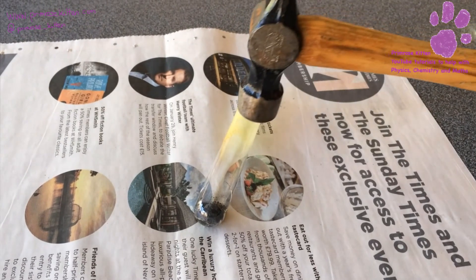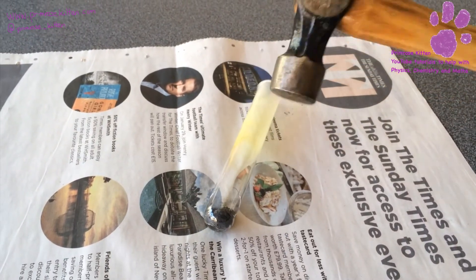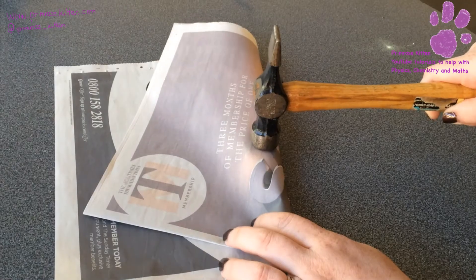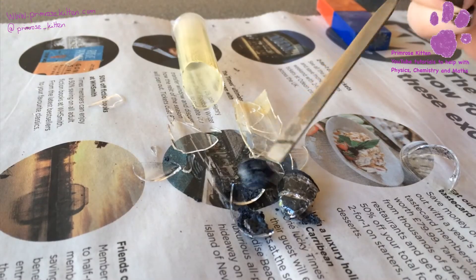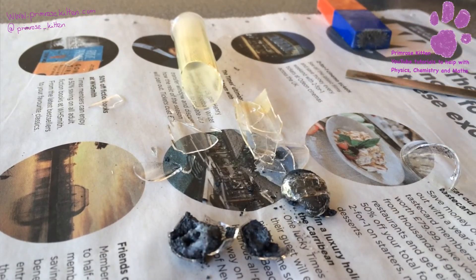So now the test tube has cooled down ever so slightly. What we are going to do is wrap it in newspaper, smash it with a hammer and see what happens. Lovely, satisfying sound there. So this is what we have — this little lump in here, which is attached to all the glass.